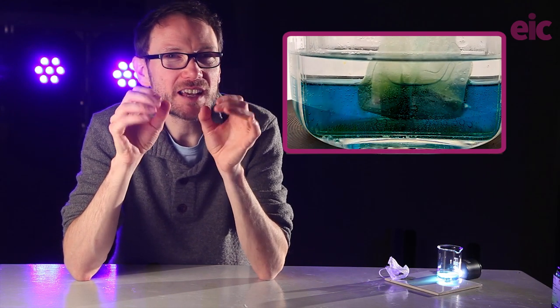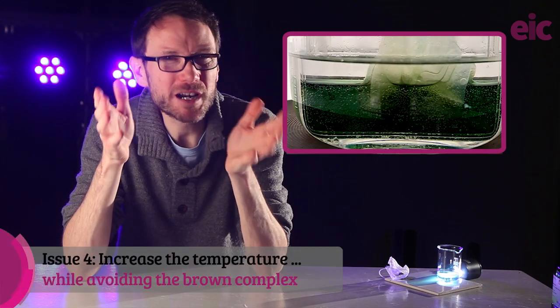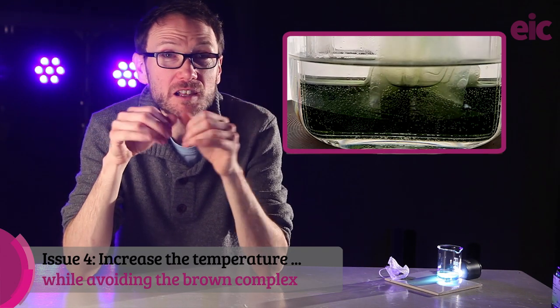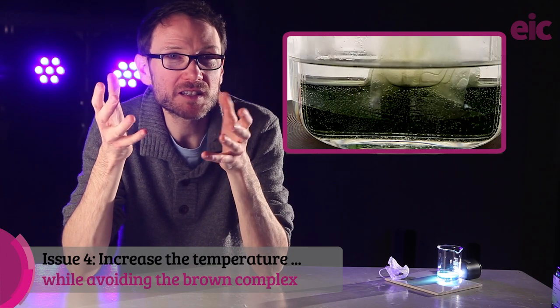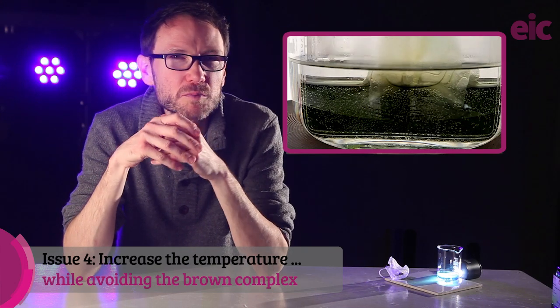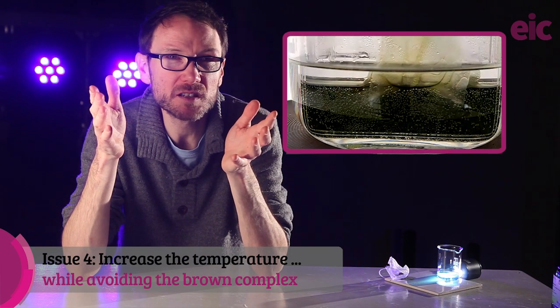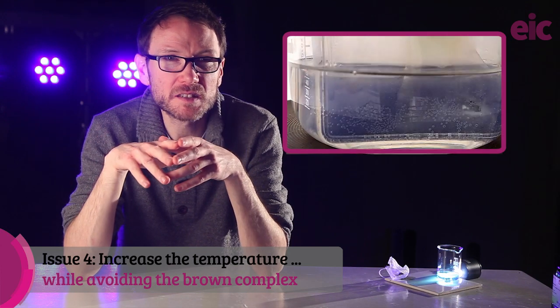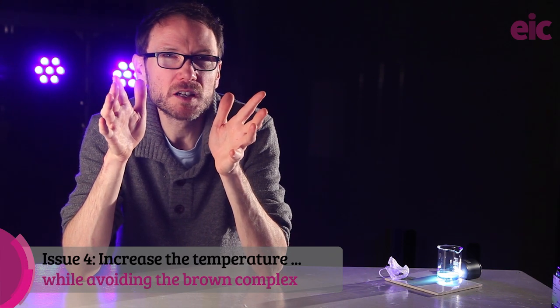The problem is that as you move past vanadium 3, brown. So what's going on here? There are a lot of other things in our mixture that the zinc is also capable of reducing, and we know that the colors that we're looking to see are highly pH dependent. This brown problem was noted by other people who'd suggested speeding up using a water bath, and it can be remedied quite easily by adding back some more acid at the end. We then get this nice purple color, but it's not exactly what we signed up for.